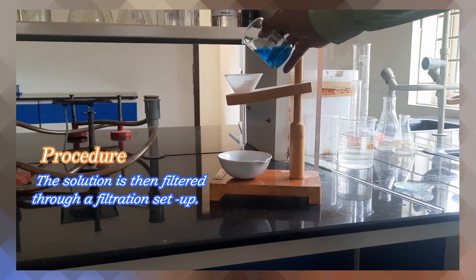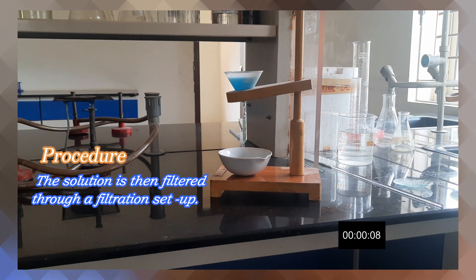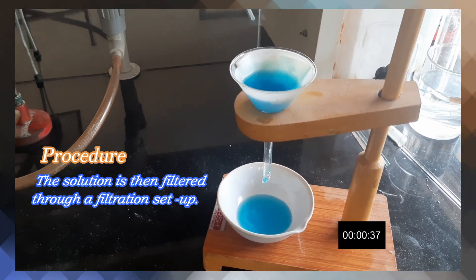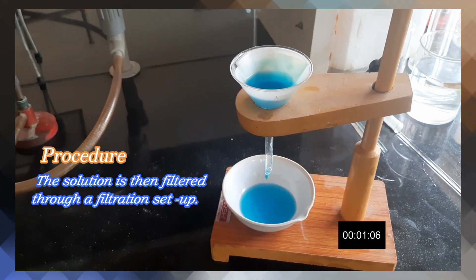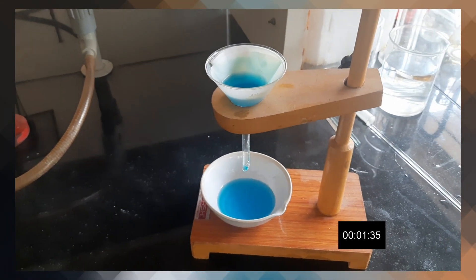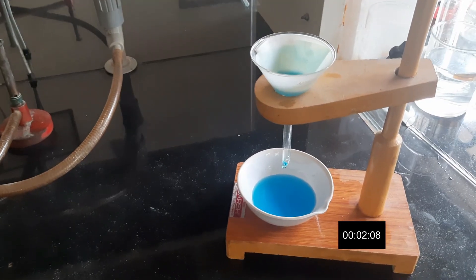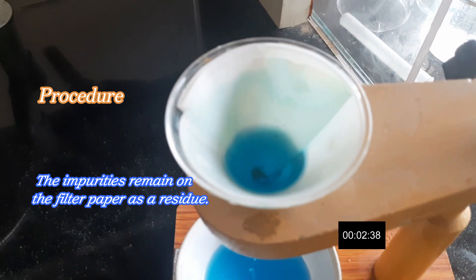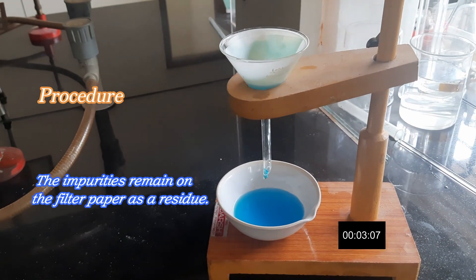The solution is then filtered through a filtration setup. The impurities remain on the filter paper as a residue.